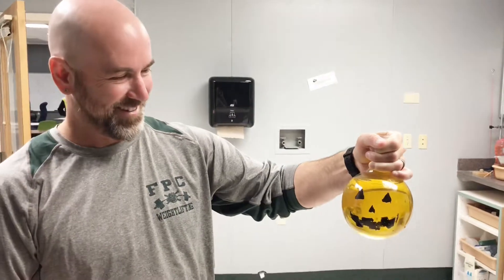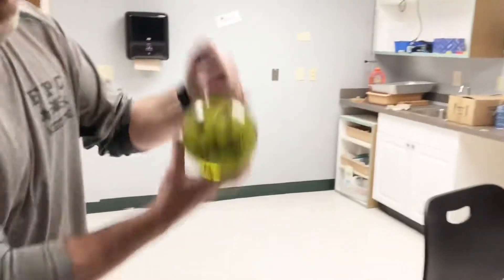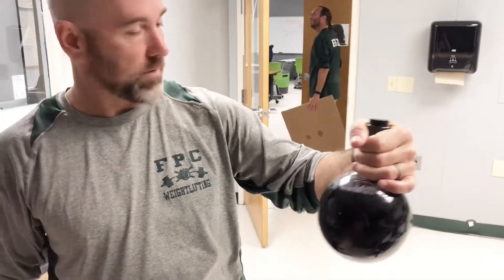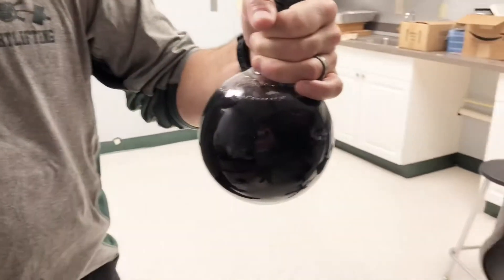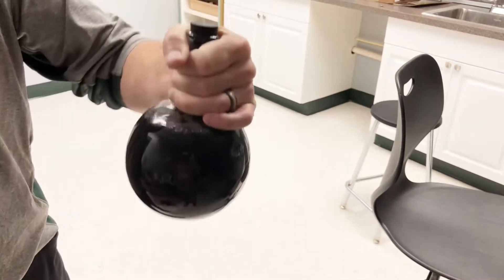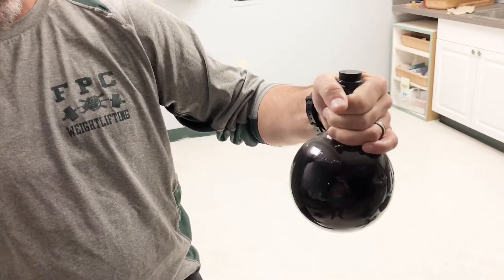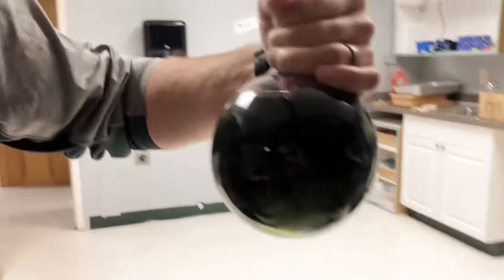You might have a yellow pumpkin, but it's cool — it's super super cool. Watch it... oh, now watch — it disappeared. That'll take longer because of how long it's been. It's always longer early on because it's so concentrated, and then the more you go the faster it gets.